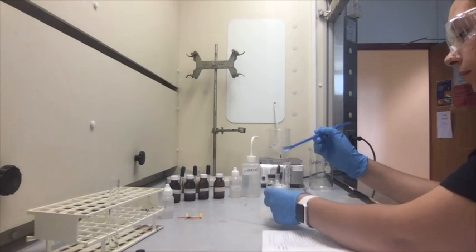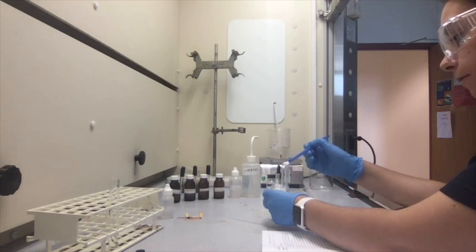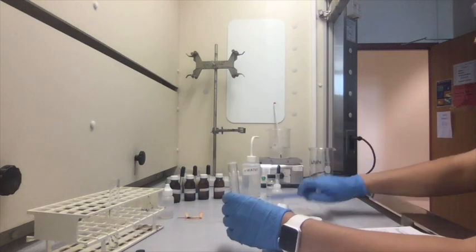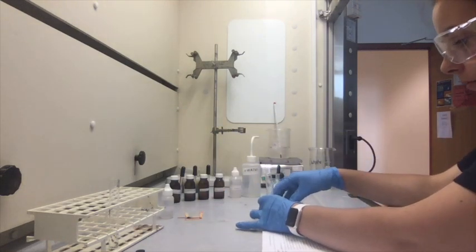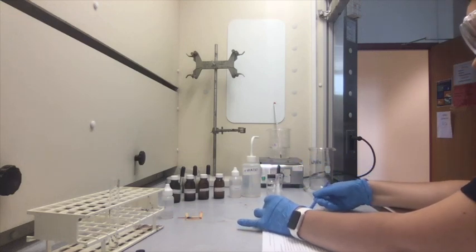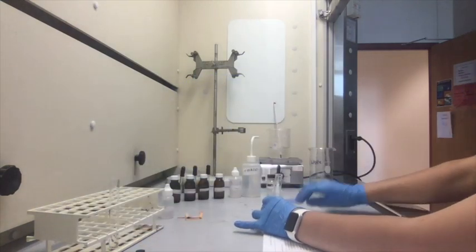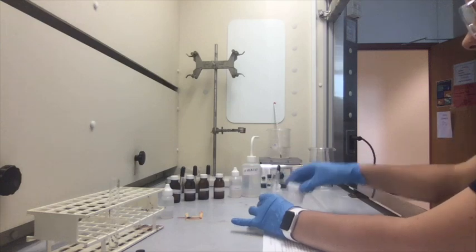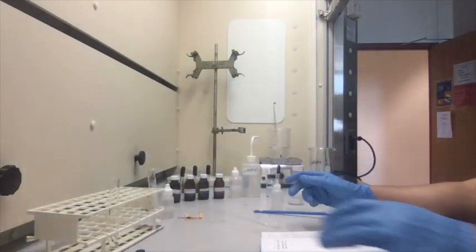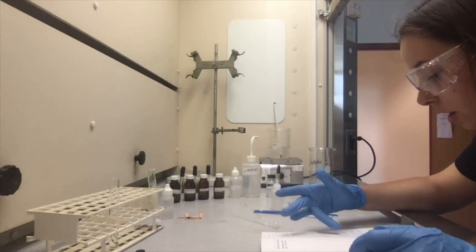So about that much, along with 2 mL of water.